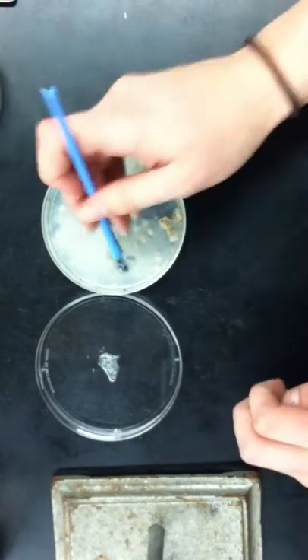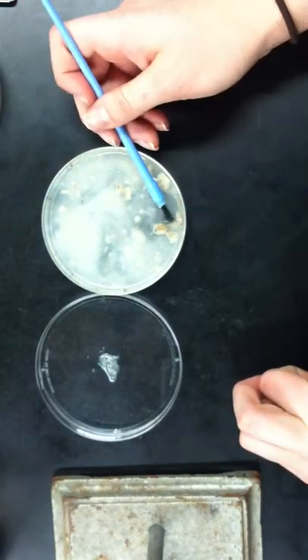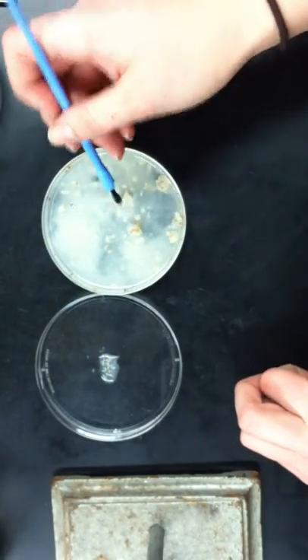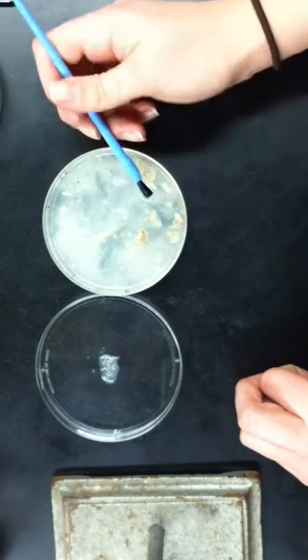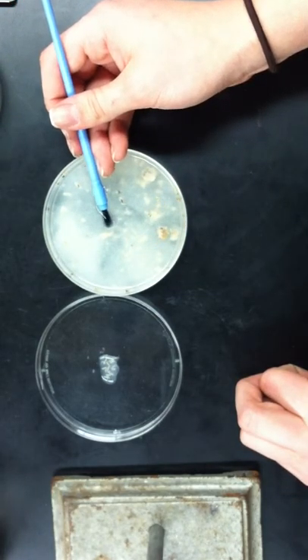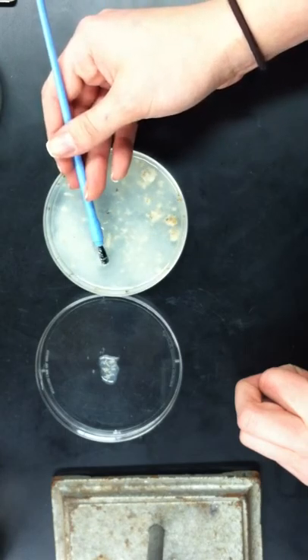And if there's more pupa, or just pupa. If there are more pupa on the sides, that means that it's been going for a while, and there's most definitely going to be larvae in there. So all these are floating to the top. They're easy to catch.